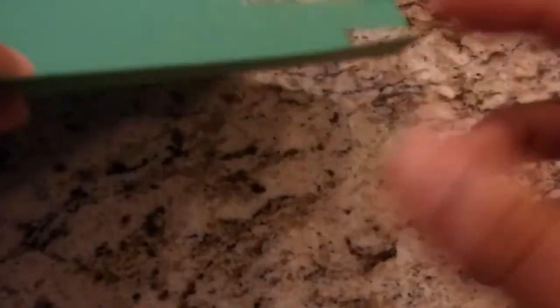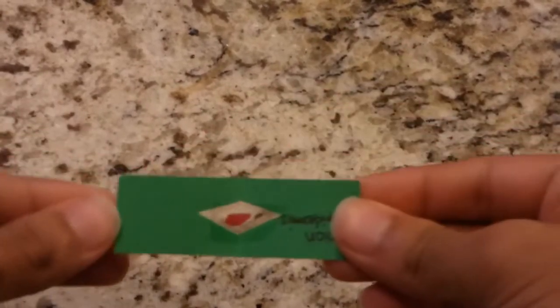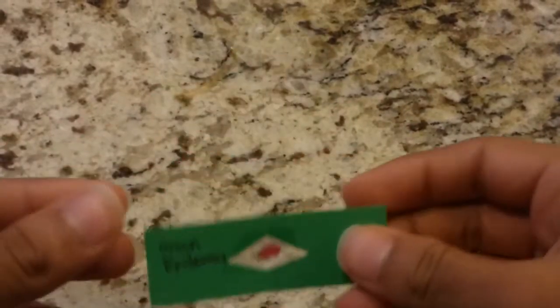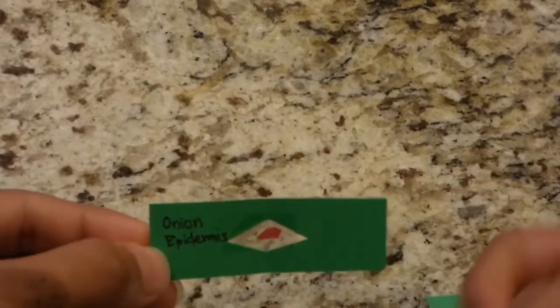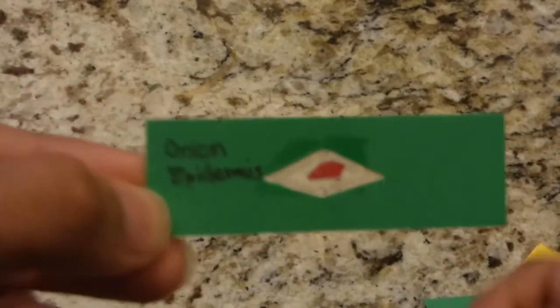Thick paper, for example, cardstock, an index card or construction paper, and lastly, scissors. You're also going to need a template for which you can trace out your slide. If you have an existing slide, that would be great. If not, you can estimate.